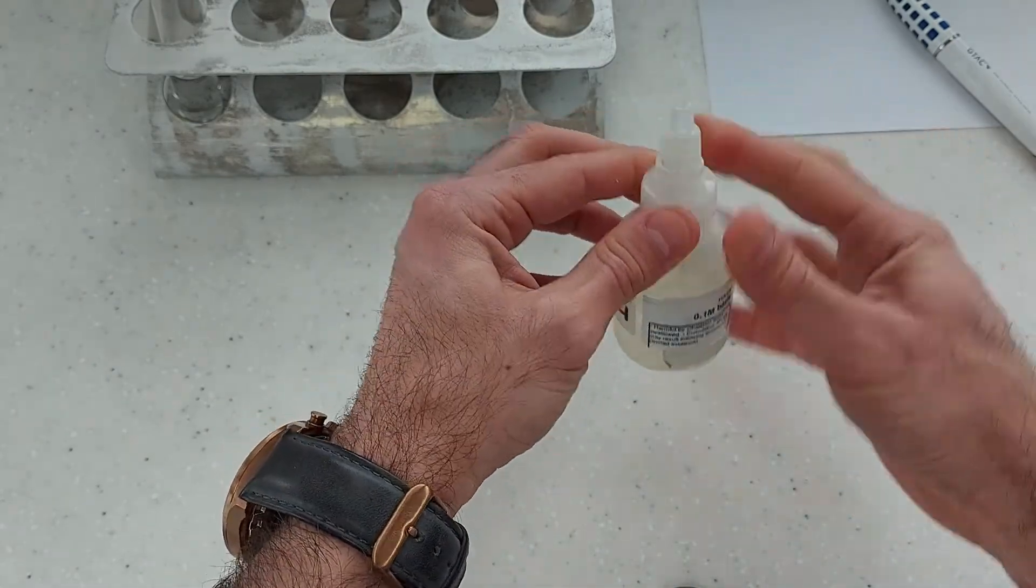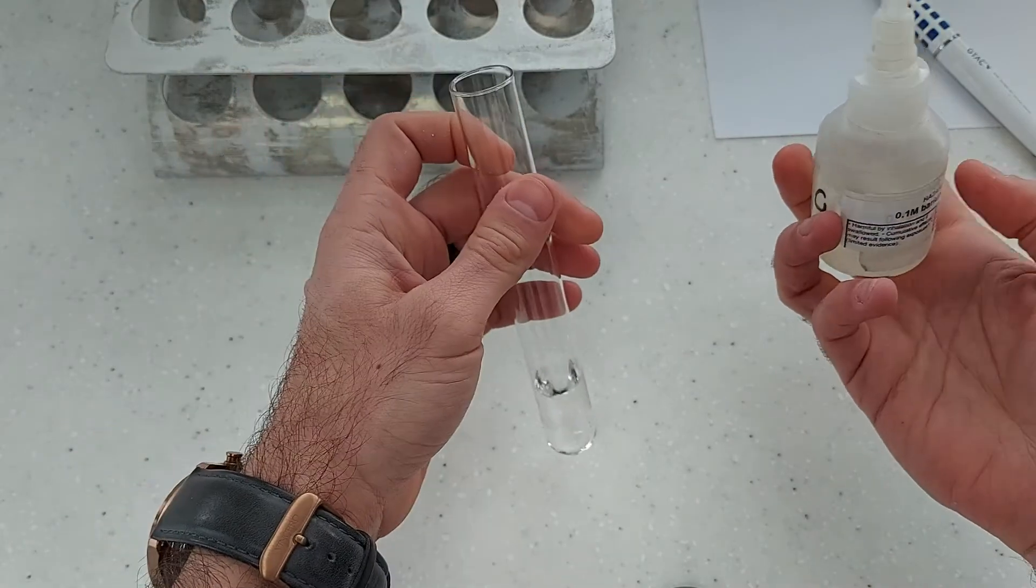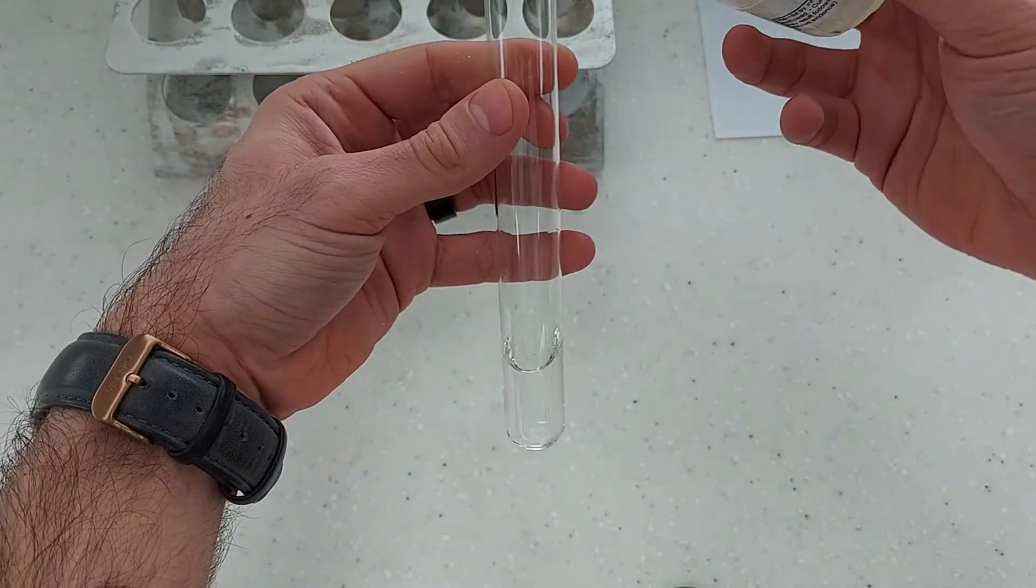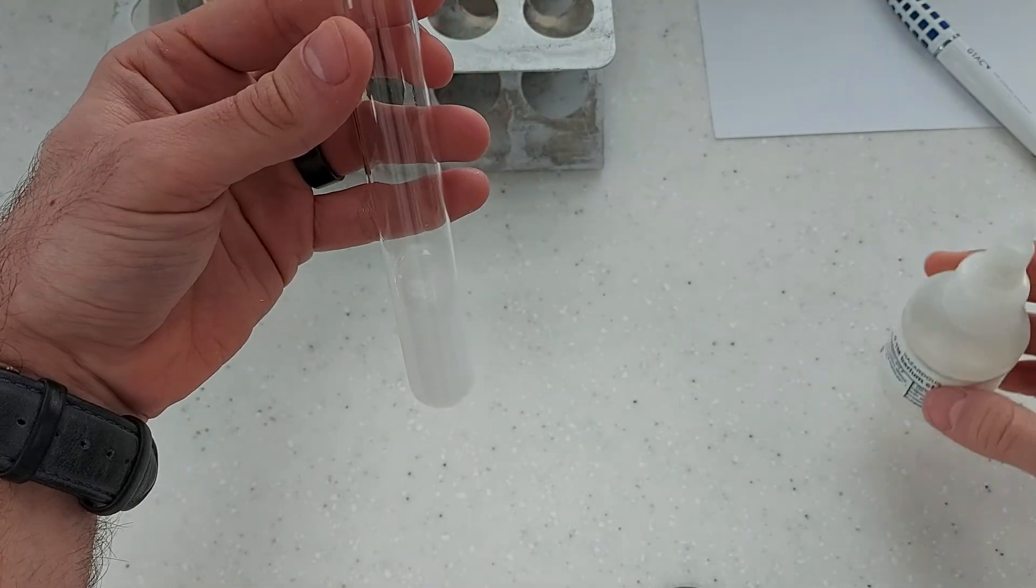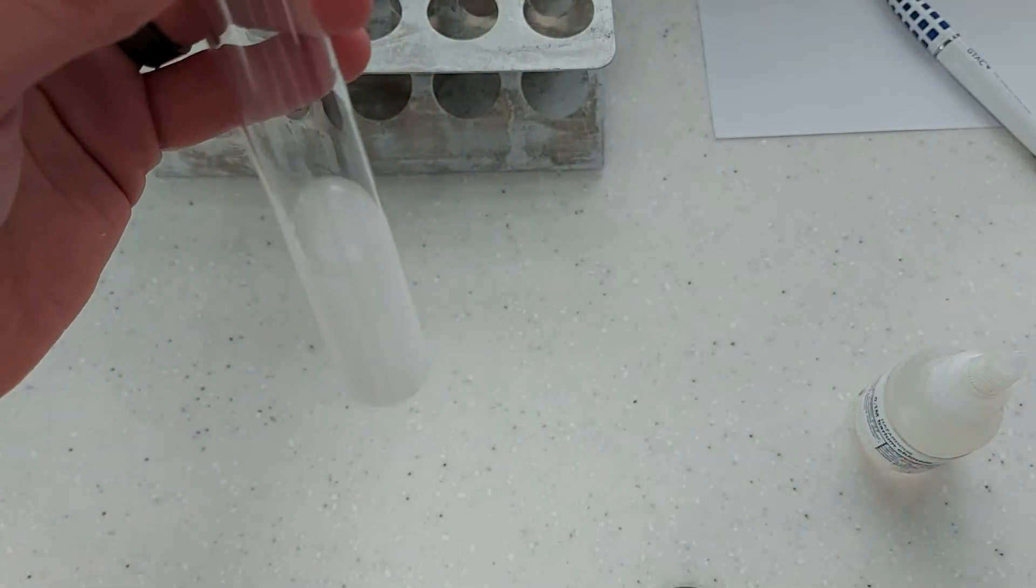Open this bottle. Okay and in it goes. And you can see that it becomes very cloudy all of a sudden.